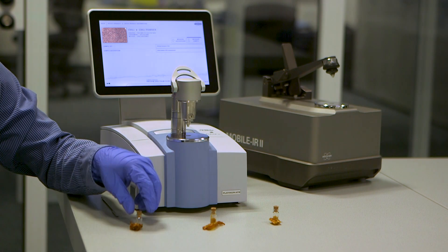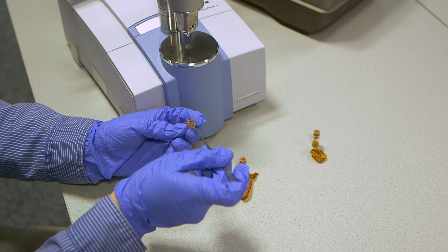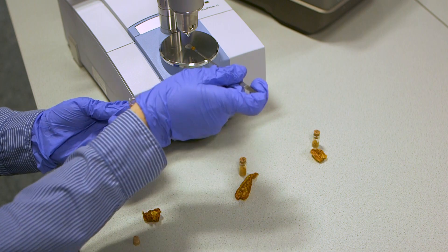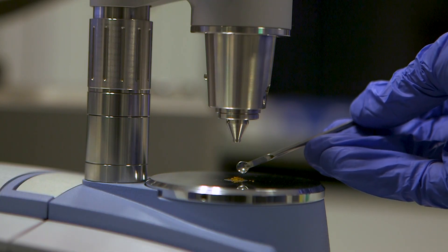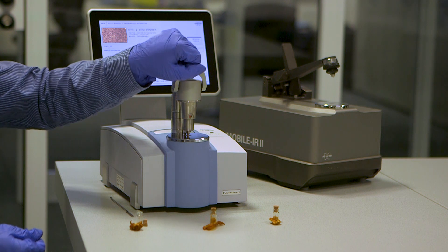We place a little bit of chili powder on the ATR crystal. We recommend to use gloves for this, since your mouth might like the tingling sensation of capsaicin, other body parts might not.